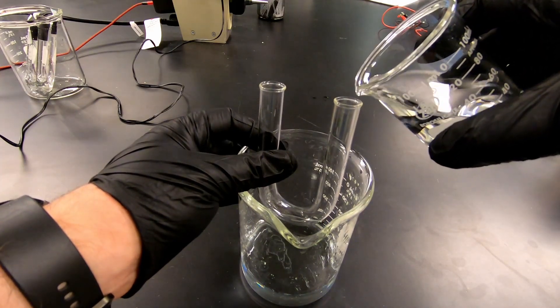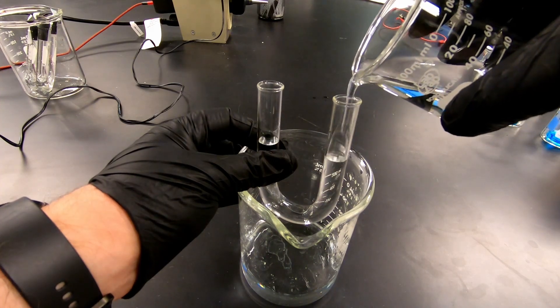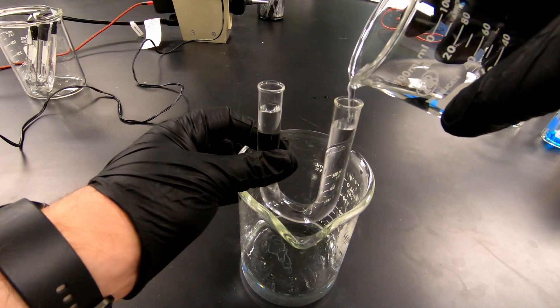But you'll just fill it off to one end. It'll raise up both sides. You'll fill it, go ahead and fill it pretty much all the way.